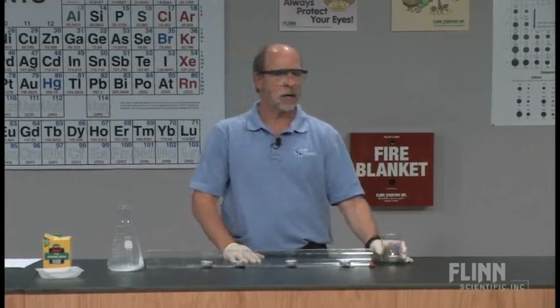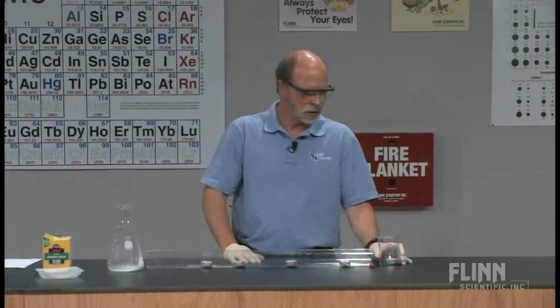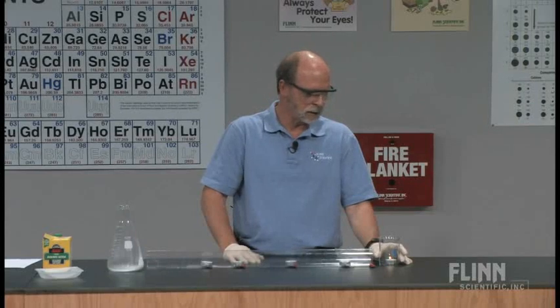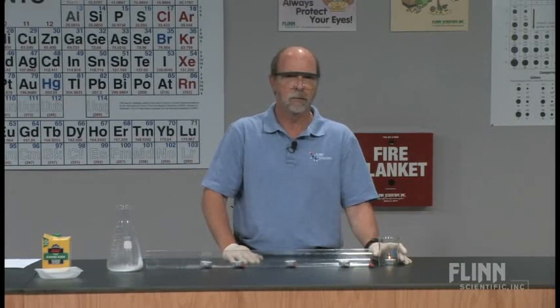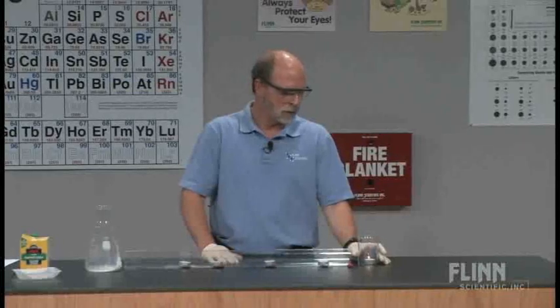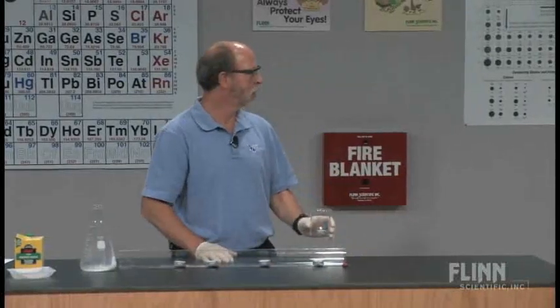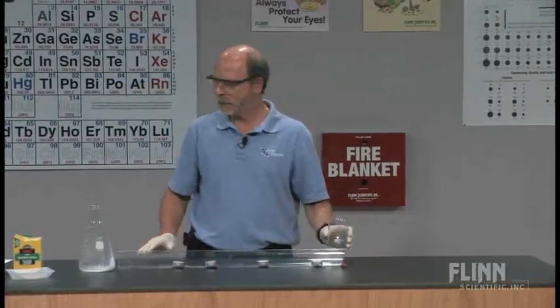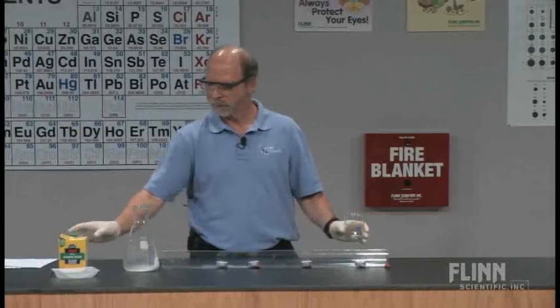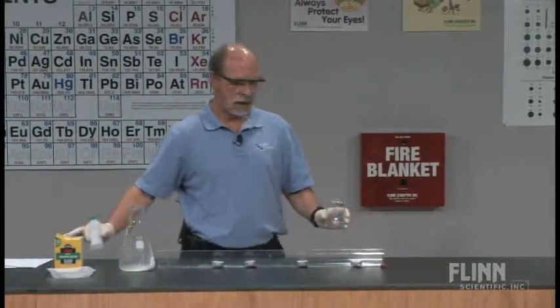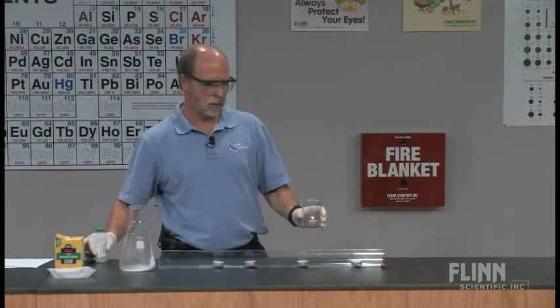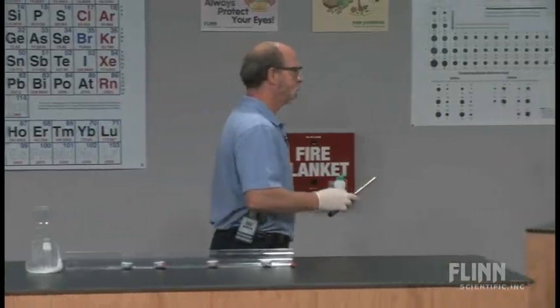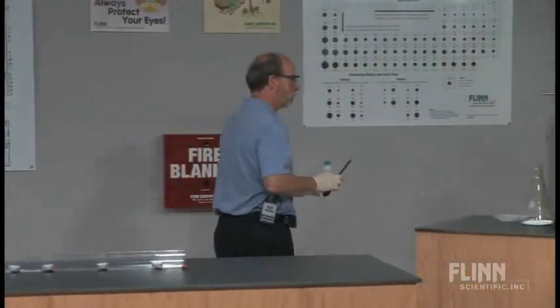Well, let's go and take a look at a homemade device that I constructed probably now five years ago. It's not the original, because in the traveling back and forth, things happen in shipping. But we're going to take a look at one a little bit more elaborate than this, and we'll see if we can get that to work. So we're going to go back to another lab table.